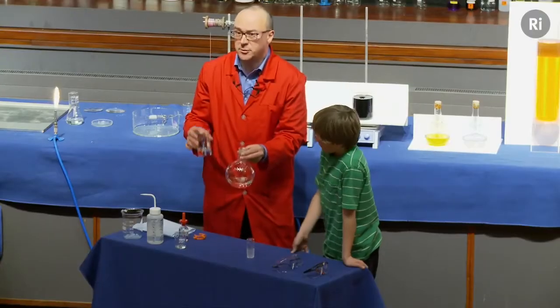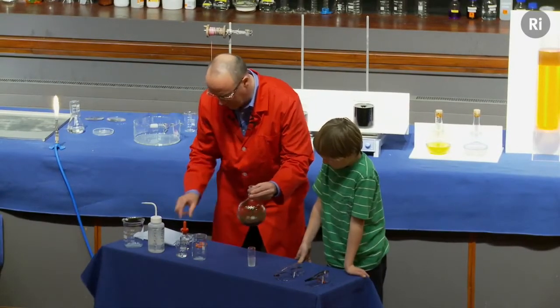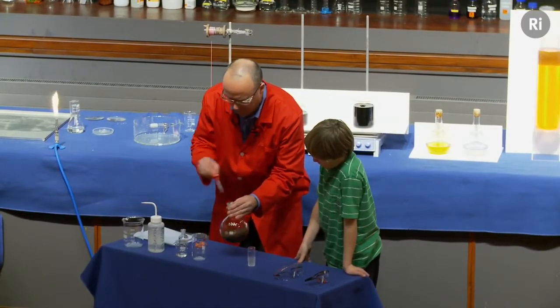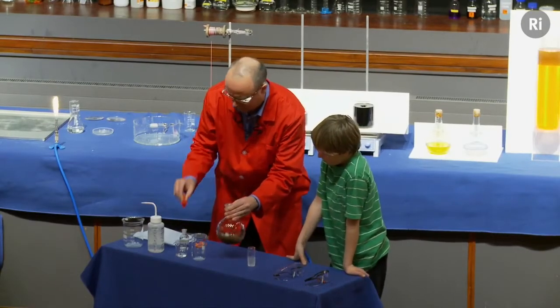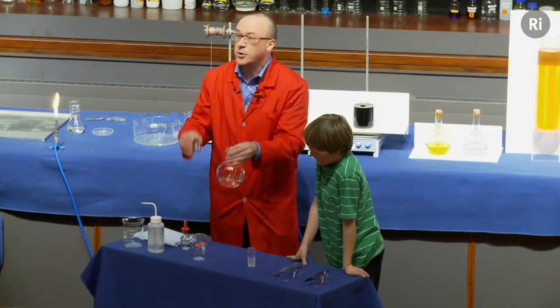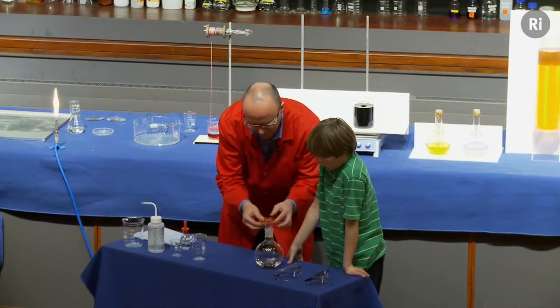Now what I'm going to do is add some sodium hydroxide. That's now formed a very dark brown, almost black material. So I'm now going to add more ammonia, and again I'm going to add ammonia until the liquid goes back to being colourless. This takes a moment or two. There we go. And then finally I'm going to add some glucose. So there's the glucose. Now I'm going to put the lid on, put a clip on.